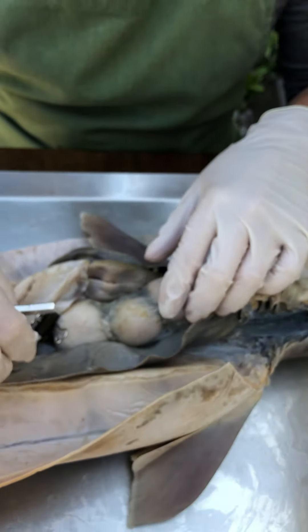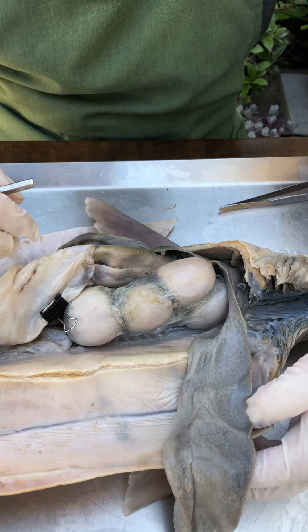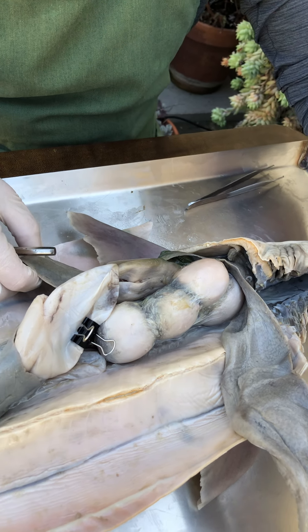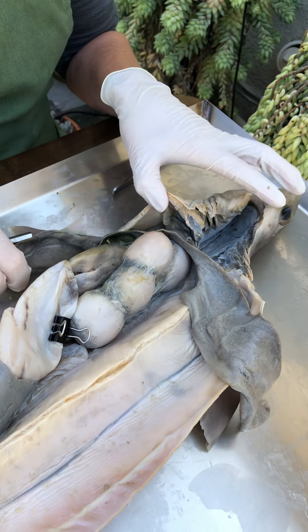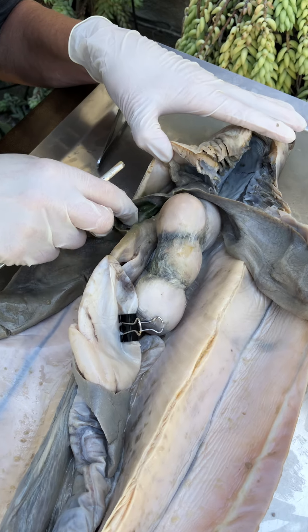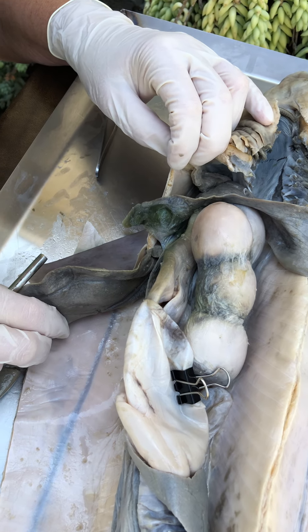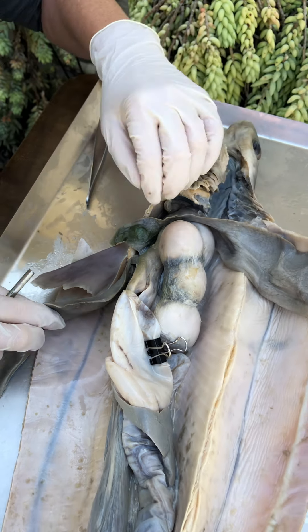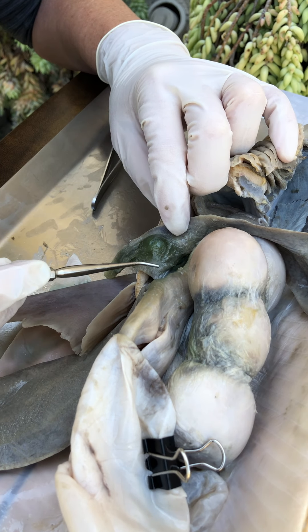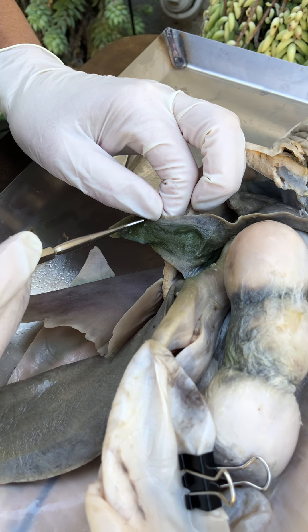As soon as we get into the peritoneal cavity, we see these really remarkable structures — a huge liver. Chondrichthian fishes have this characteristic huge fatty liver, and it's hypothesized to increase buoyancy — it's super oily. We have a right lobe of the liver, a left lobe, and a median lobe. On the deep surface of the median lobe, you'll find this sac-like structure — that's the gallbladder.